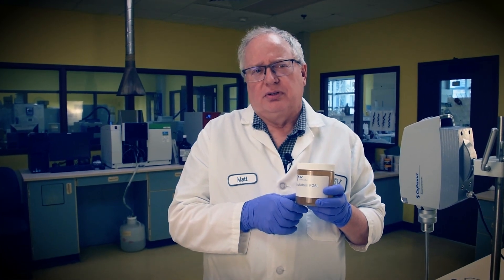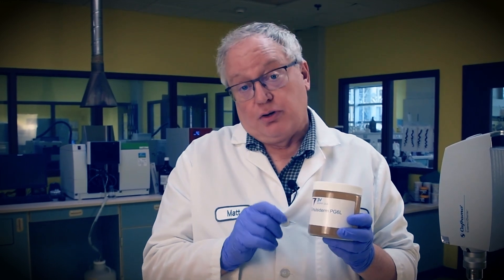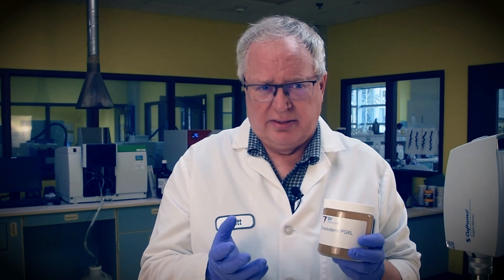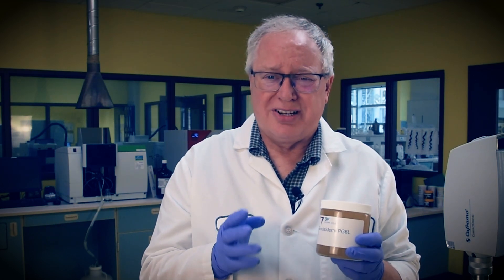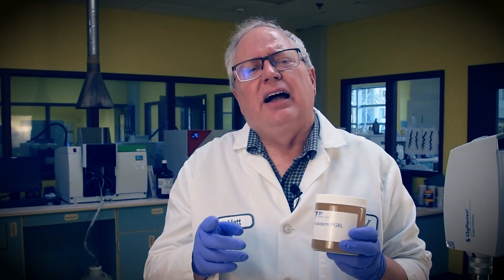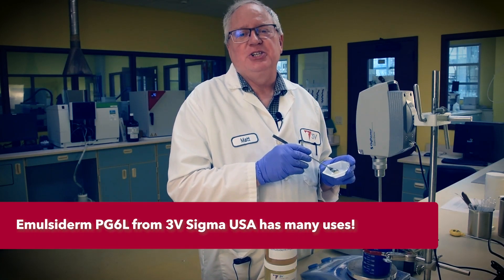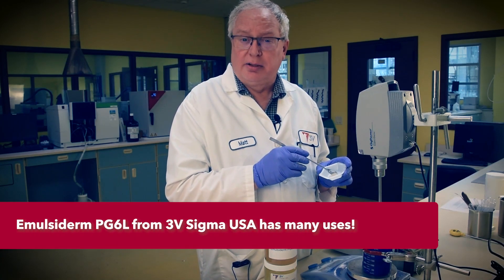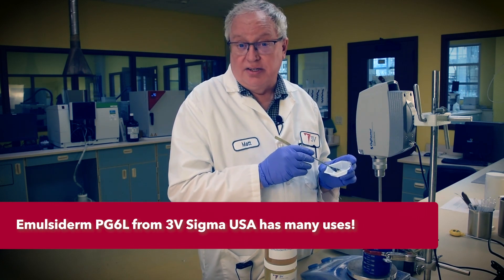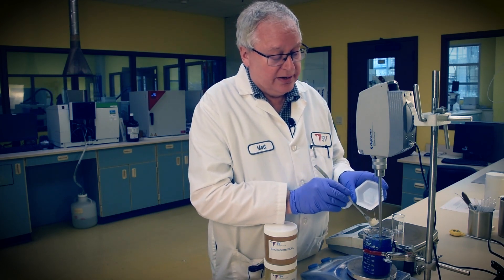Here we'll use a new tool to act as a hydrotrope — one of our 3V Sigma Emulsiderm PEFAs. Hydrotropes assist other materials such as sodium stearate to be more water soluble. Most are surfactants, but most surfactants will not work as hydrotropes, though they may use hydrotropes to work better. So we'll add our Emulsiderm PG6L — the PEFA polyglycerol-6 laurate — both for its hydrotrope action with the other ingredients and its nice sensorial contribution. Being esters, these PEFAs do that better than most non-ionic surfactants.